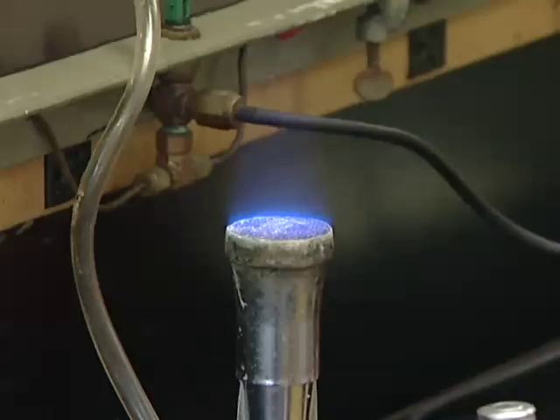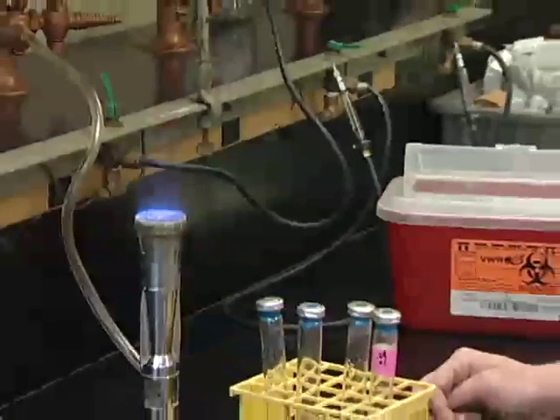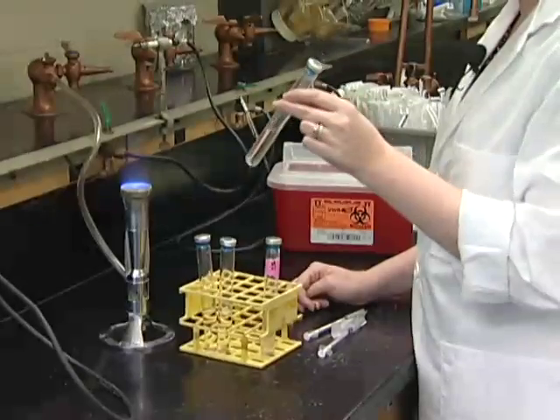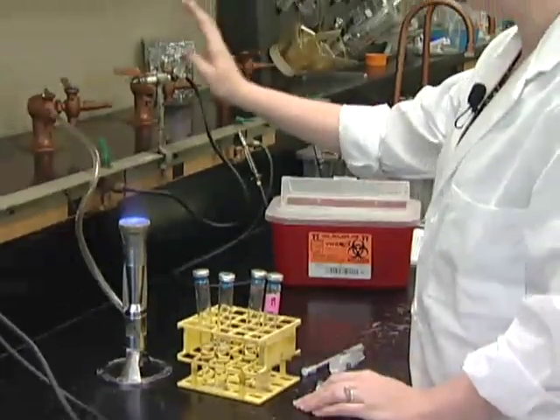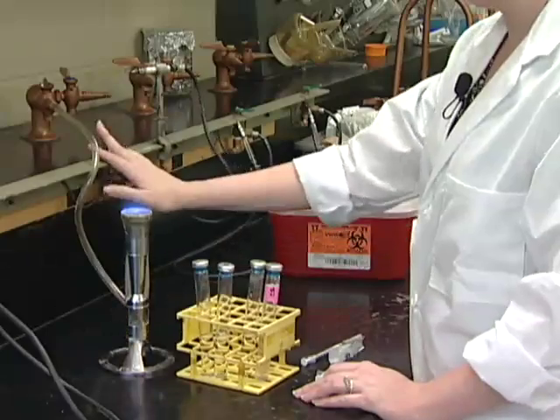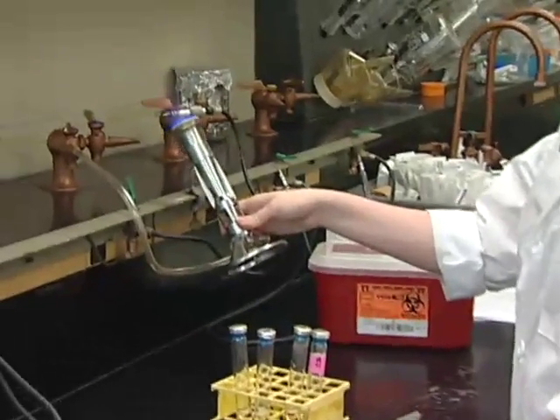Now that you've made your sodium sulfide and your media is ready, it's time to transfer. So you'll want to grab your already grown up culture and your fresh tubes of media, and we'll start with a sterile gassing probe and your flame. So turn on your gas here and flame your probe.